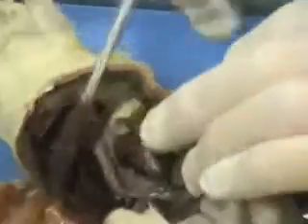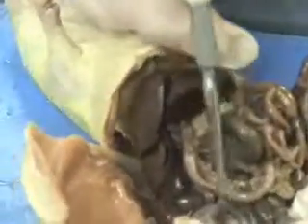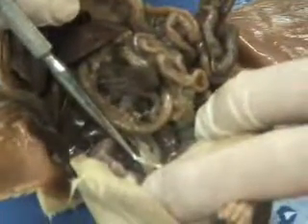As we loop back around, though, it's really tough to tell exactly where small intestine and large intestine are. Small intestine is easiest to see right next to the stomach, back here again. Large intestine, if you follow that large intestine out, we've got a tube that's going to lead out right here, and that large intestine is going to lead to the rectum and the anus.